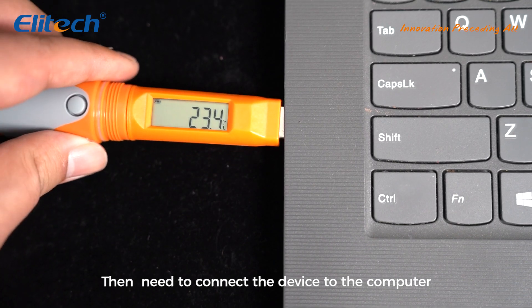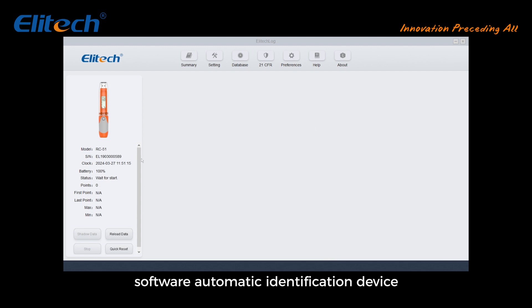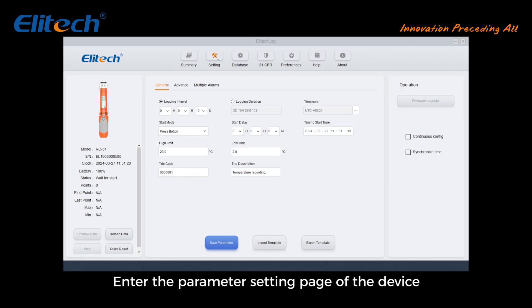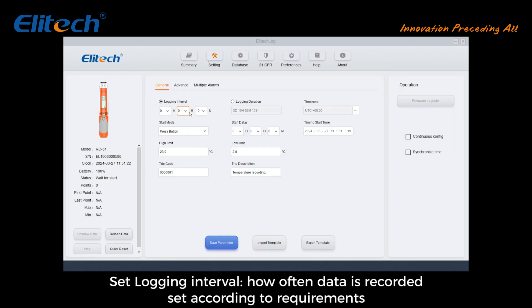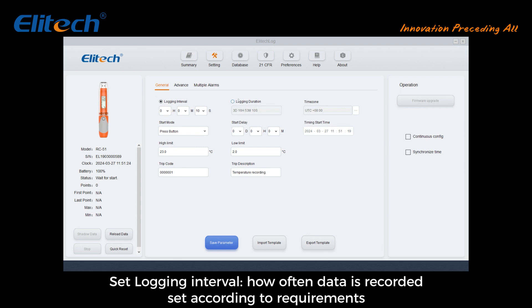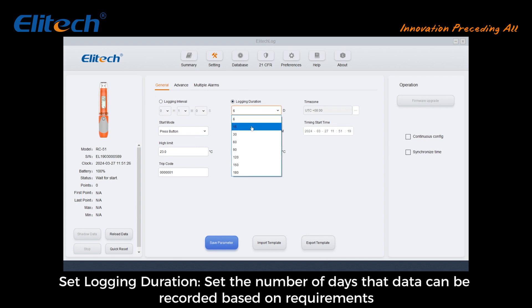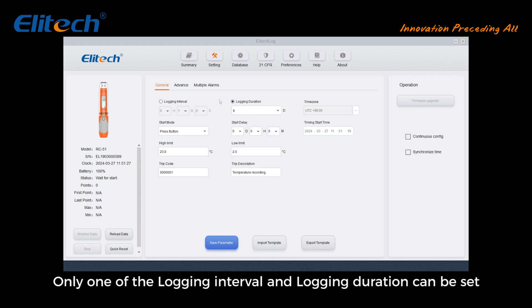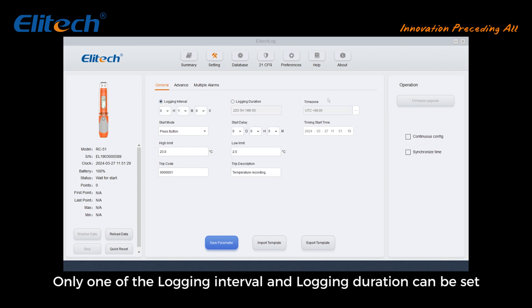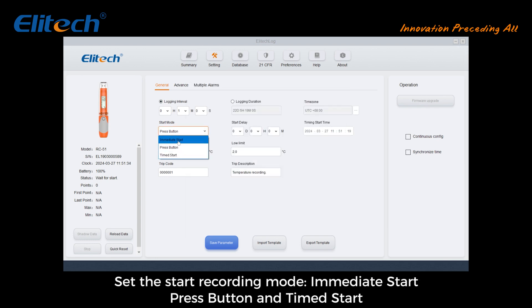Connect the device to the computer — the software will automatically identify the device. Click the settings button above to enter the parameter setting page. Set the logging interval to define how often data is recorded, and set the logging duration to define the number of days data can be recorded. Note: only one of logging interval or logging duration can be set.